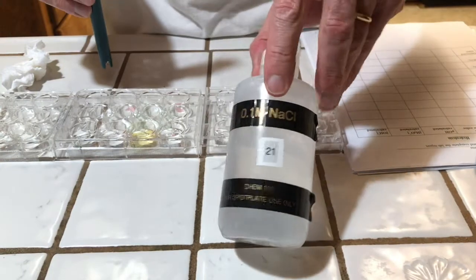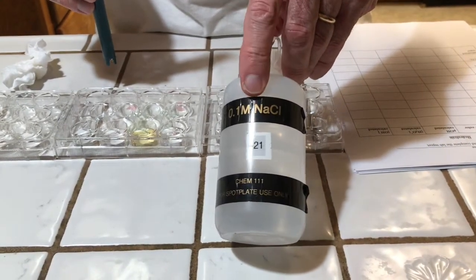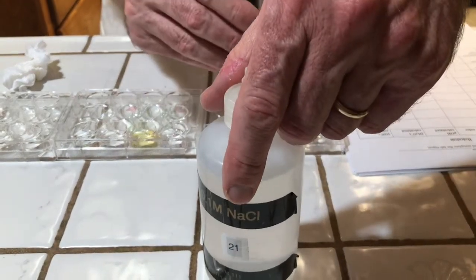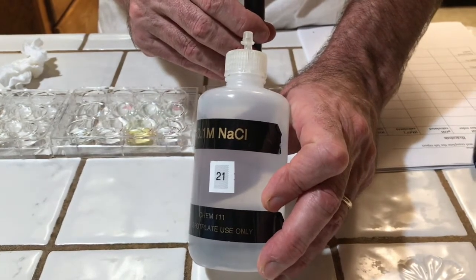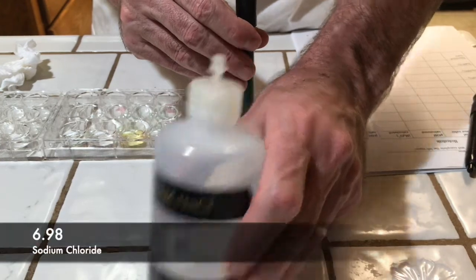Our next salt is sodium chloride. It's the salt of a strong base and a strong acid, sodium hydroxide and hydrochloric acid. That's our third. So what do you think the pH should be? Should sodium chloride react with water? Comes in right at 6.98.